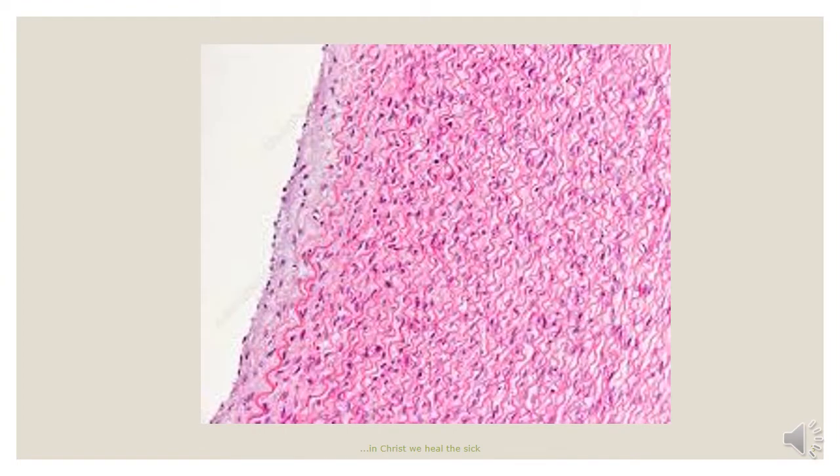This particular slide is stained by the H&E stain, and as we said earlier in the first episode, the elastin fibers can also be stained with H&E, in which case they take up a pink stain. So we can identify the lumen here, and then our tunica intima, then the broad tunica media. In this tunica media, we can see the wavy appearance of the elastin fibers moving up and downwards, but this time it's stained pink because of the H&E.